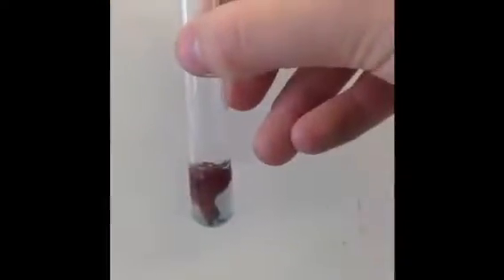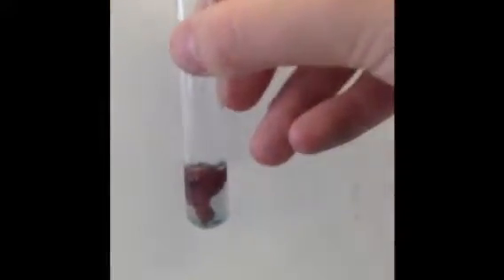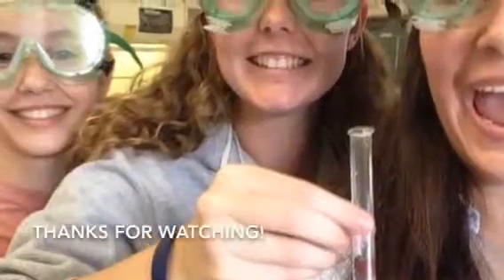As you can see, the aluminum foil appears to be turning a red color. In reality, this is the formation of the solid copper. Our final result was a red solid copper and a clear aqueous solution.